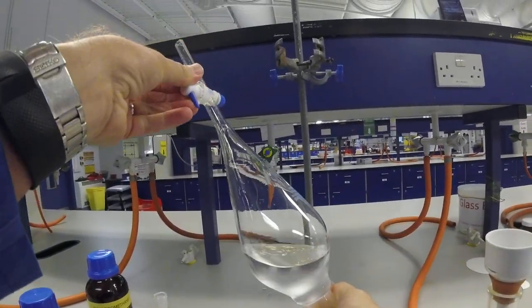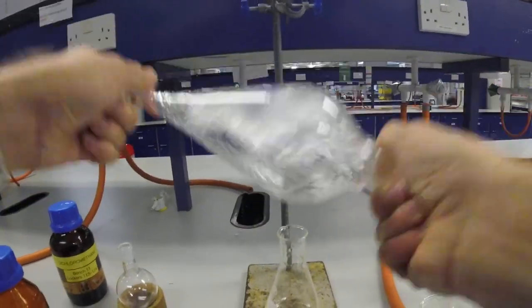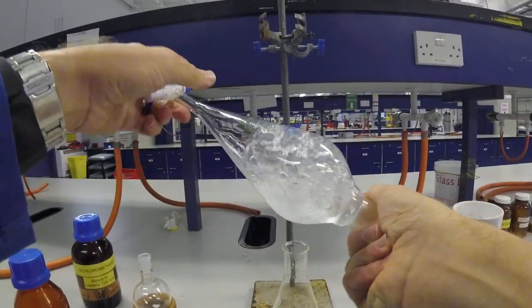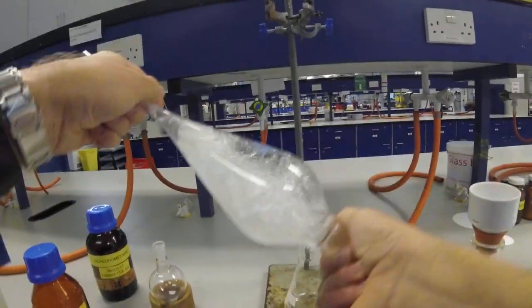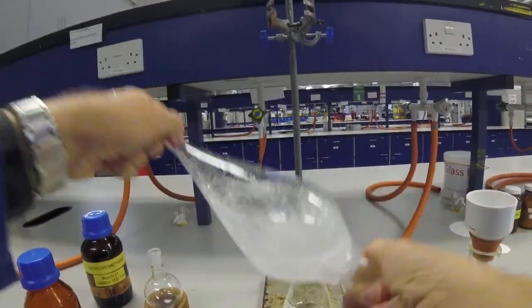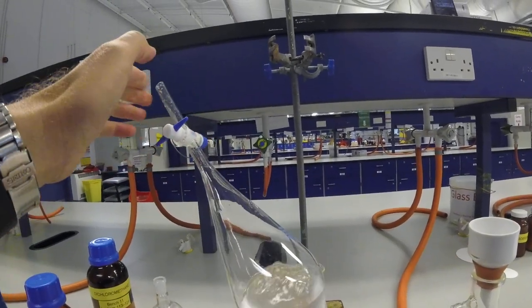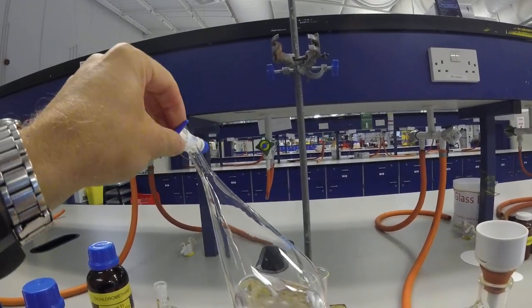And open the tap again. Do that a few more times. Really get those layers mixed. Be aware of who else is around you and make sure you don't point the tap at anybody, just in case things fly out at the end.